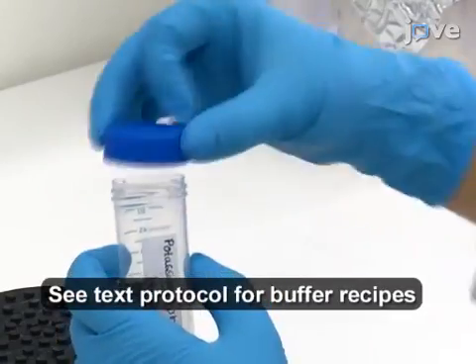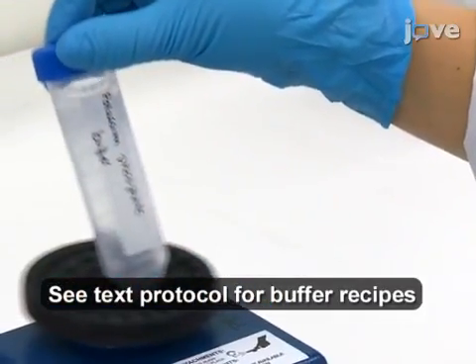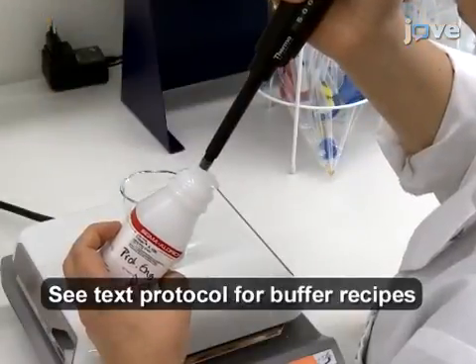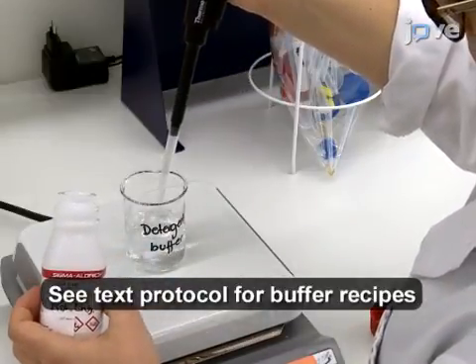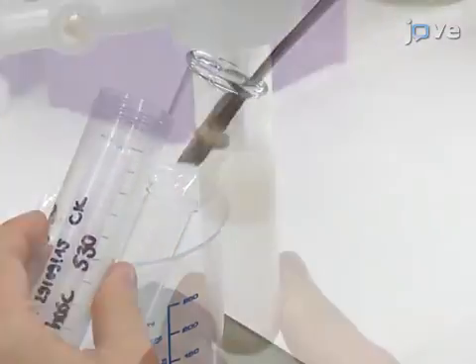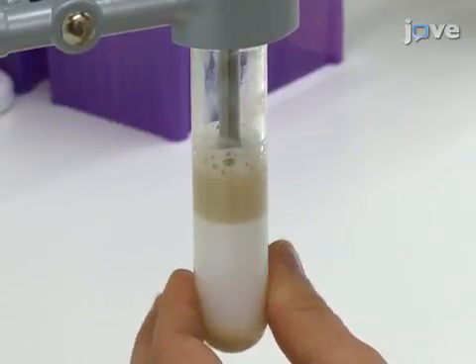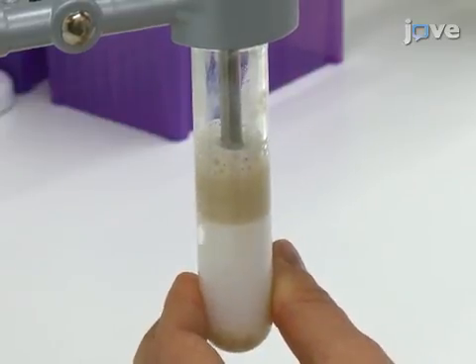Prepare a potassium phosphate resuspension buffer, detergent buffer, and reaction buffer as listed in the text protocol. For squalene hopene cyclases or other membrane-bound enzymes with a lower pH optimum, use a citrate-containing resuspension buffer. Weigh a frozen cell pellet in a glass beaker. Resuspend the cells in resuspension buffer using a homogenizer to a final concentration of 0.3 gram cells per milliliter.